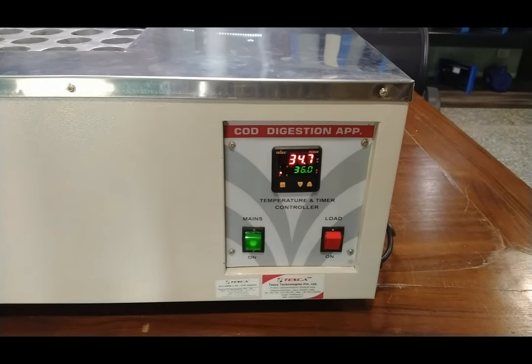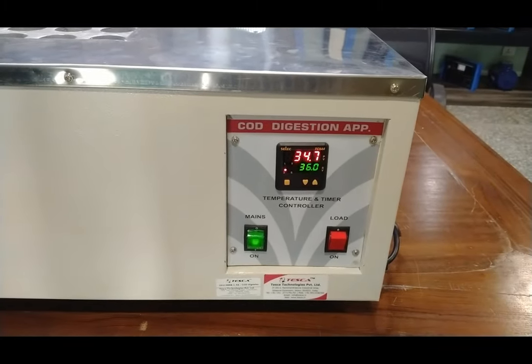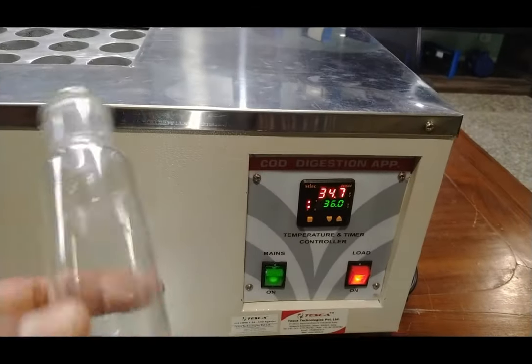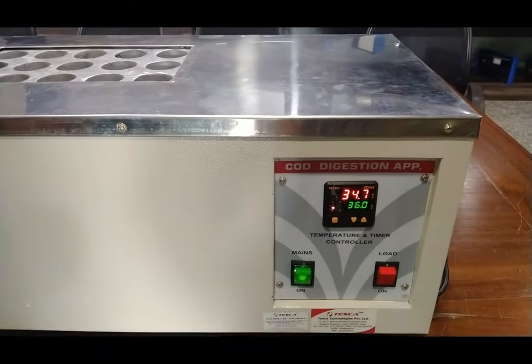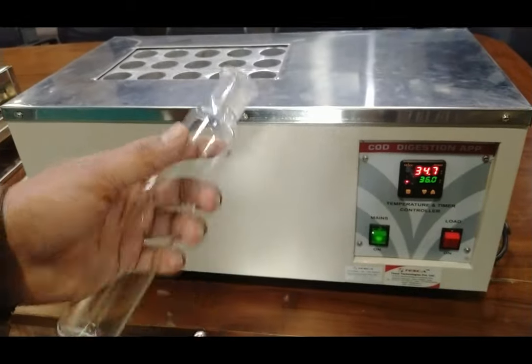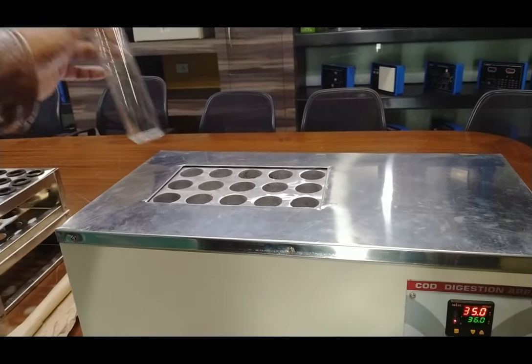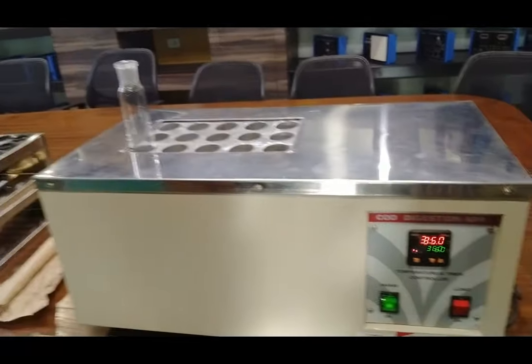With this COD digestion apparatus we have a COD test tube. We can place this COD test tube in the 40mm diameter hole and fill chemical into it. Using these chemicals we can perform our experiment in the chemistry lab. It will heat up the chemical when the test tube is filled with chemical.